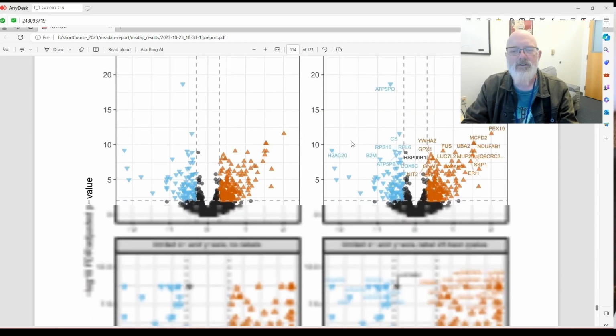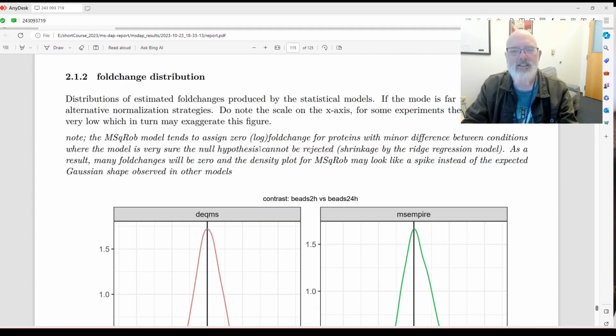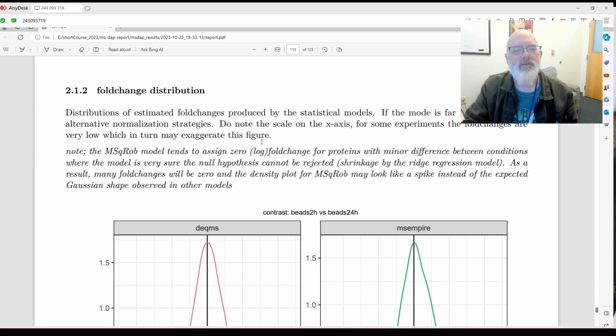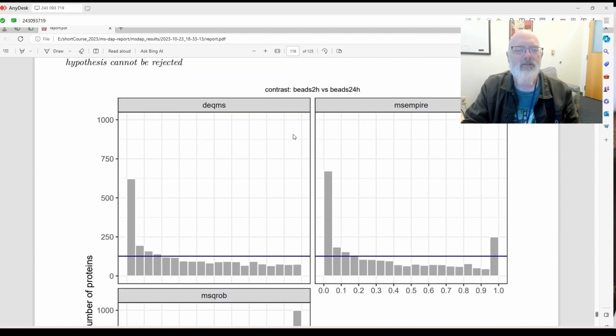Okay, so that's really cool, and you could do that for each metadata. And all our metadata was kind of ridiculous since I didn't know what that meant at the beginning. Fold change distribution by each statistical model. Okay, that's kind of cool. P-value distribution. I really like p-value charts.